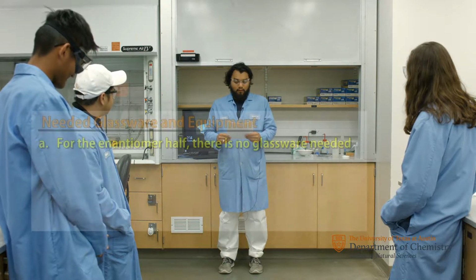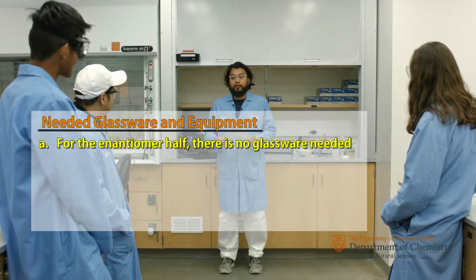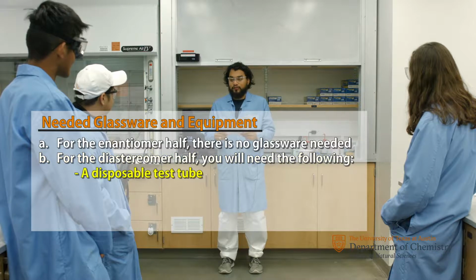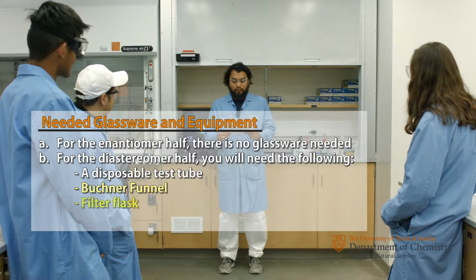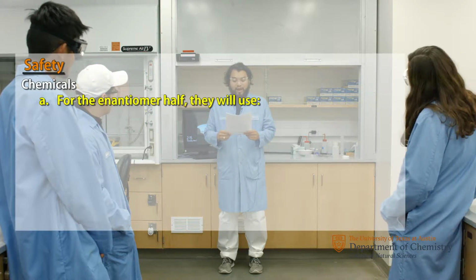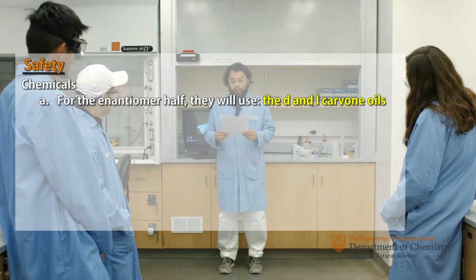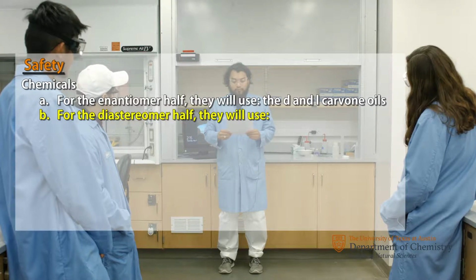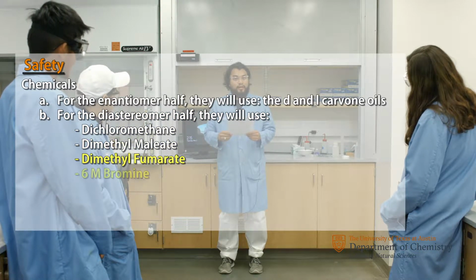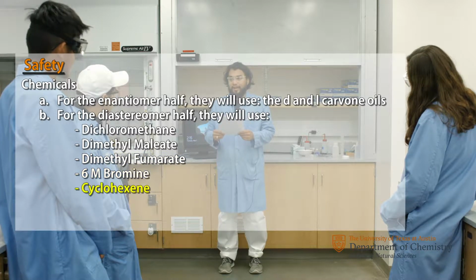This is the Stereochemistry lab overview. For the glassware needed for the enantiomer half, there is no glassware needed. For the diastereomer half, you need the following: a disposable test tube, a Buchner funnel, a filter flask, and a small beaker. For the chemicals being used for the enantiomer half, you will use the D and L carvone oils. For the diastereomer half, you will use dichloromethane, dimethyl maleate, dimethyl fumarate, 6 molar bromine, and cyclohexene.